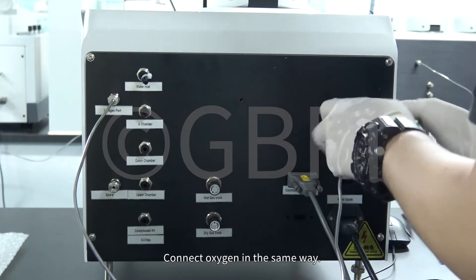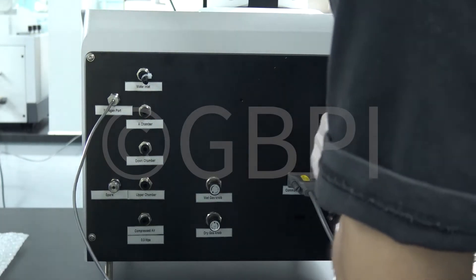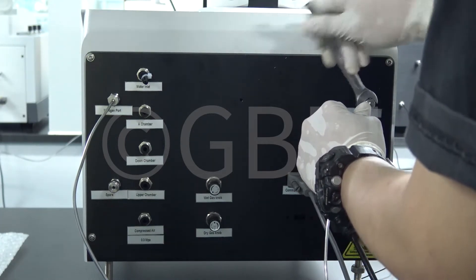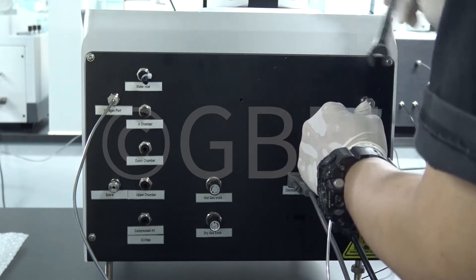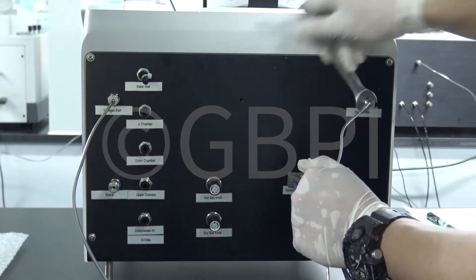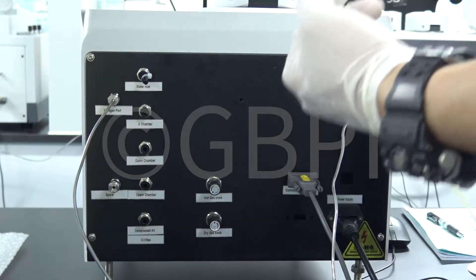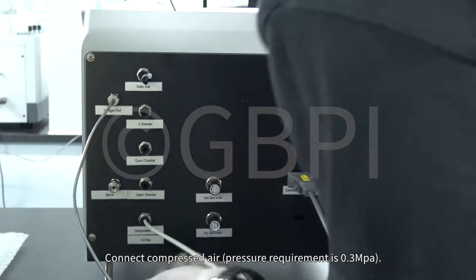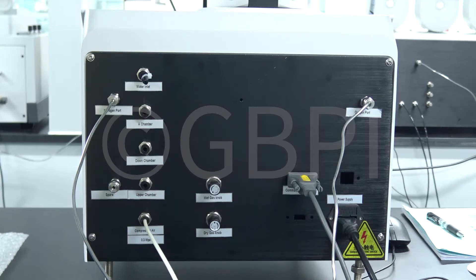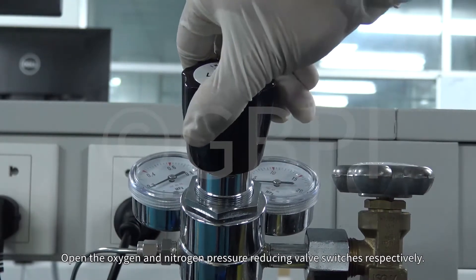Connect oxygen in the same way. Connect compressed air. Open the oxygen and nitrogen pressure reducing valve switches respectively.